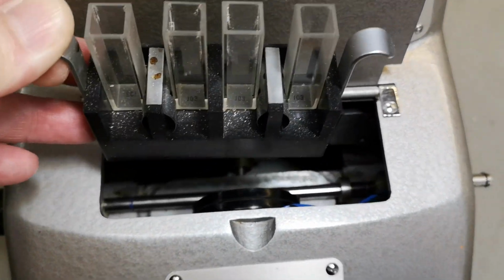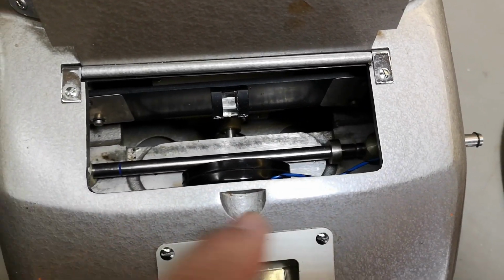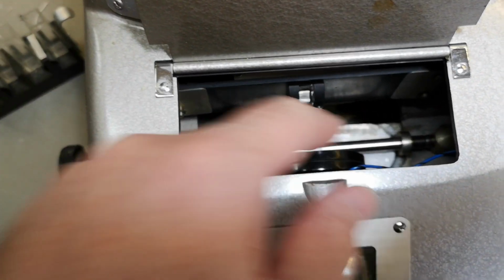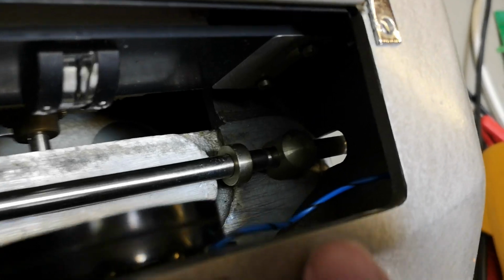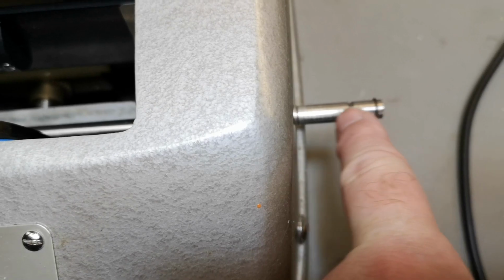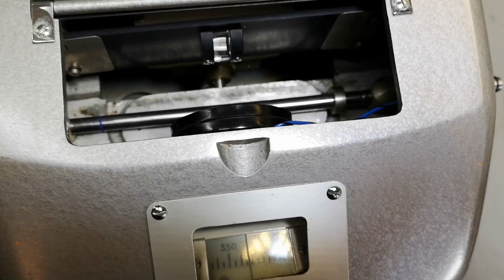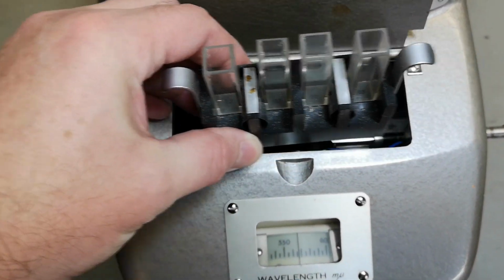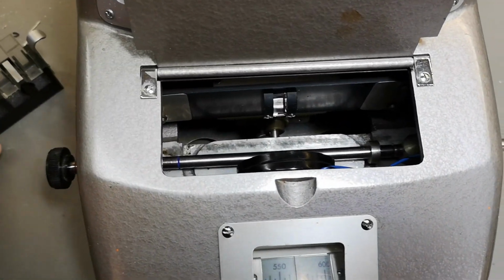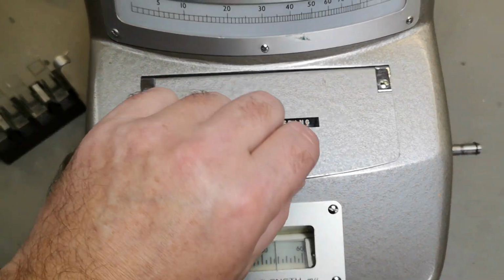So you stick this down here, and then it can move left or right, and then you pull this, tickety tickety tack, and then you pull your samples back and forward, and we got those clicks here at this rod. So that means it's going to hold the sample at the correct positions, so the 4 positions, so you know where you are when you have the lid closed, and then you pull in and out.